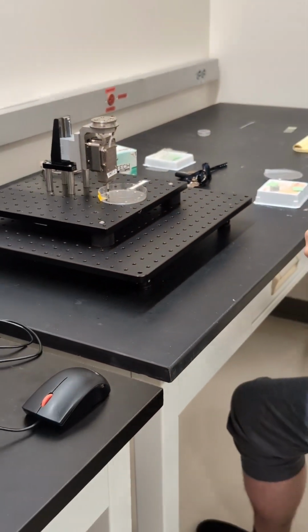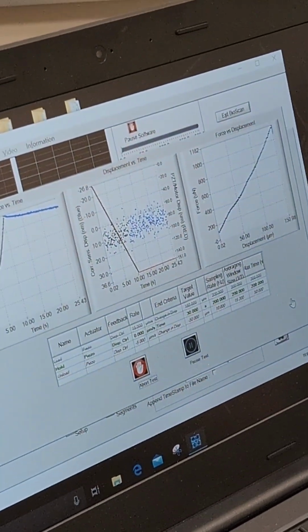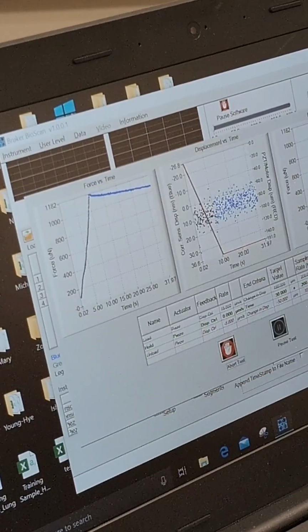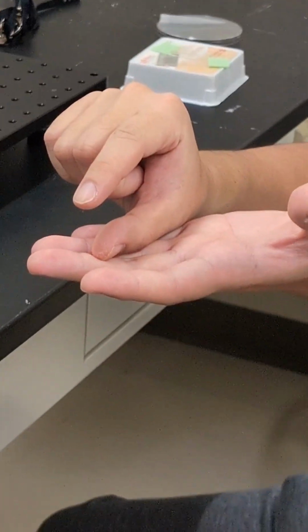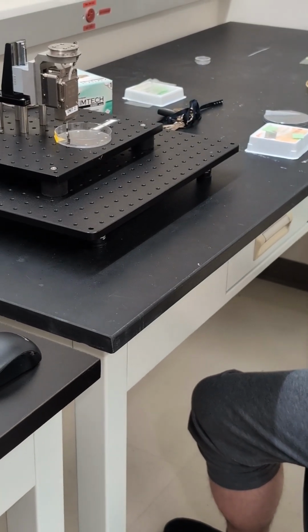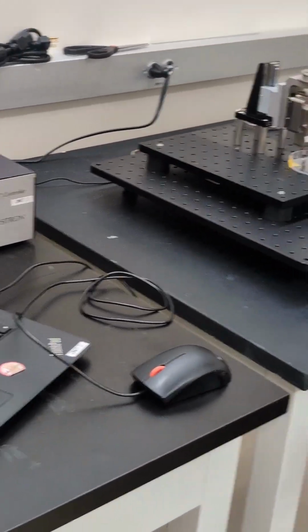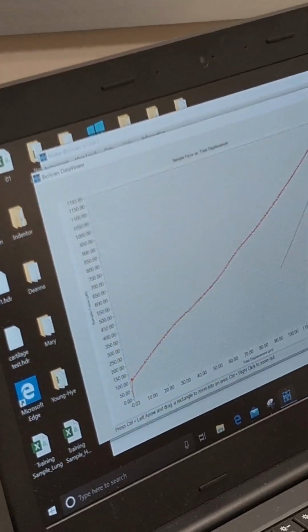So this is equivalent of after it absorbs the force, absorbs the energy, the hydrogel starts to deform, and with this deformation, the kinetic energy that it absorbs starts to get released out. Think of a spring. When you press it down, the spring gets tight. It also gets energy, but when you stop applying this force, instead of acting like a spring, because this is not a hard material, it will slowly go back up, but it will also slowly degrade its original structure. So your energy release comes in two forms. One is the spring, the other one is the dashpot. And that's exactly how the equation was constructed.